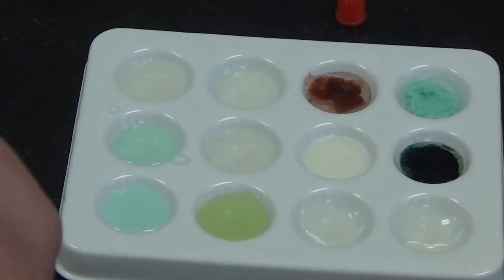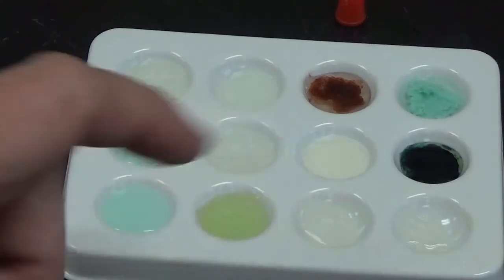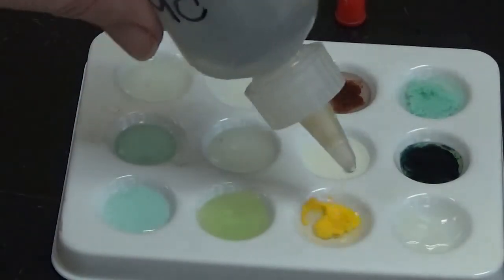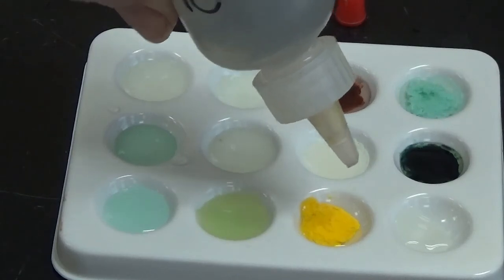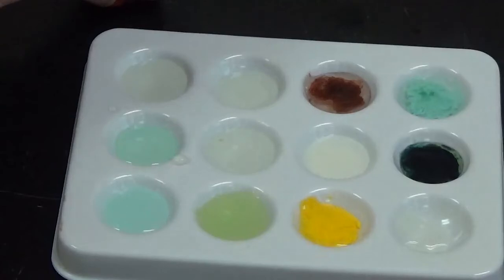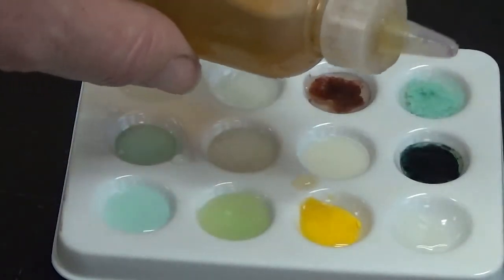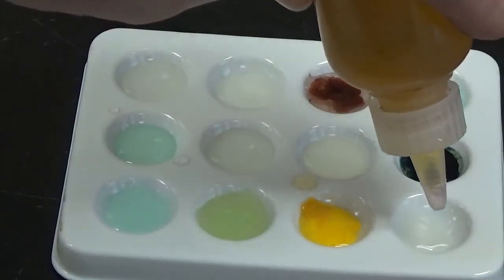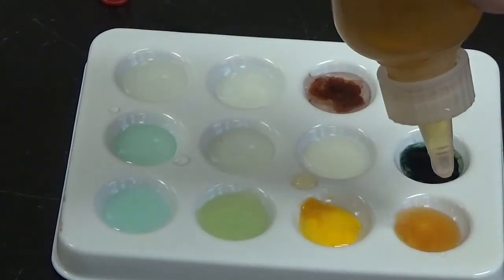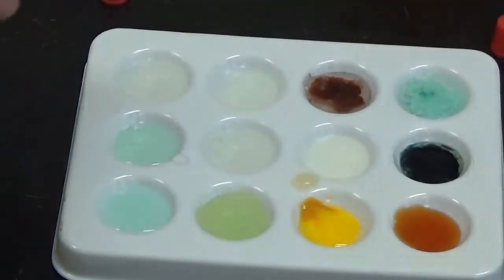Okay. So now to the potassium iodide, I am going to add lead 2 nitrate in this well. Very vibrant color change, so you know what that means. And then to this well right here, I'm going to add the iron 3 nitrate. Again, very vibrant color change, so you know what that means. So now I'm going to put this tray back.